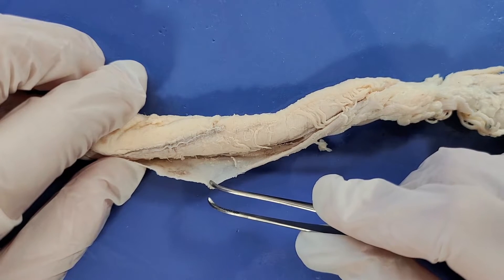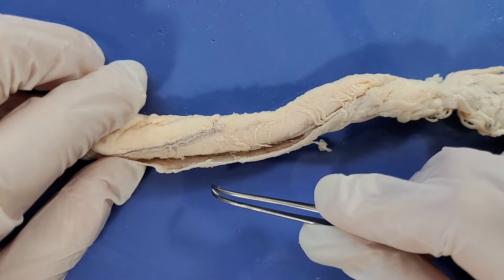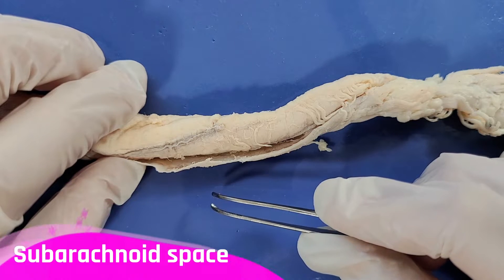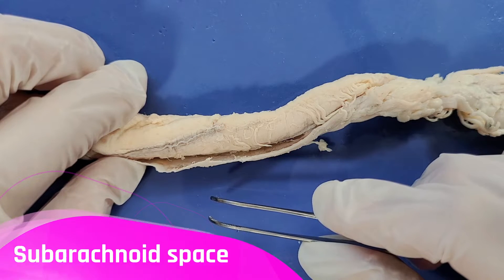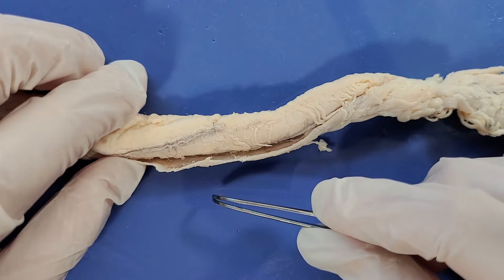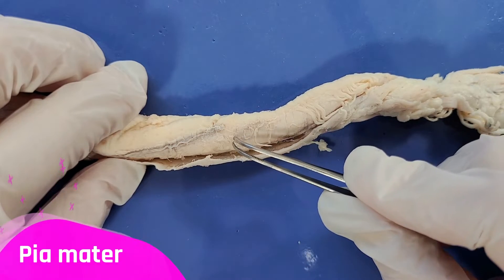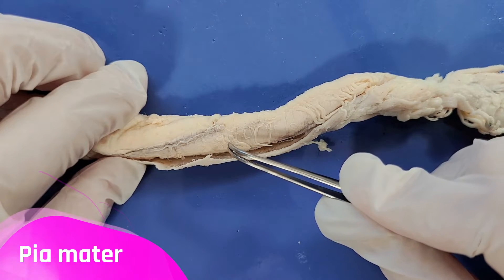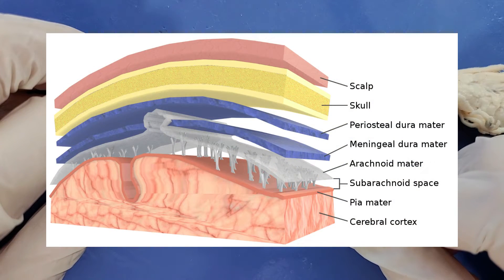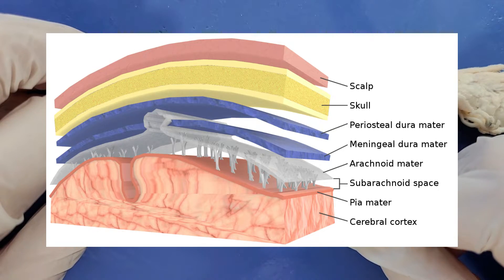This forms a space between the arachnoid mater and the innermost meningeal layer, the pia mater. This space is called the subarachnoid space and is filled with cerebrospinal fluid, which protects the spinal cord and cushions it from shock. You can see the pia mater here — this very thin layer that is flush against the surface of the spinal cord. The pia mater has blood vessels that deliver oxygen and nutrients to the spinal cord.